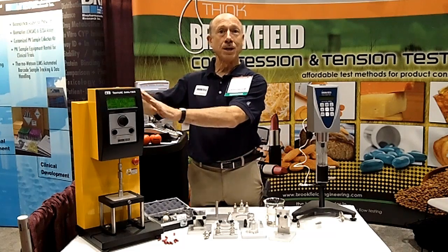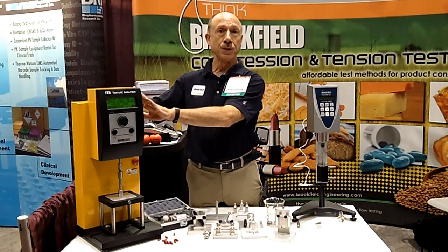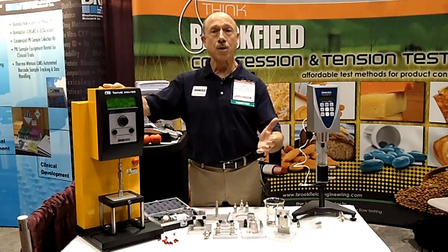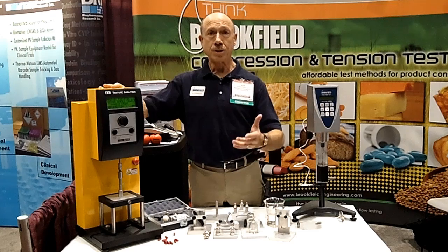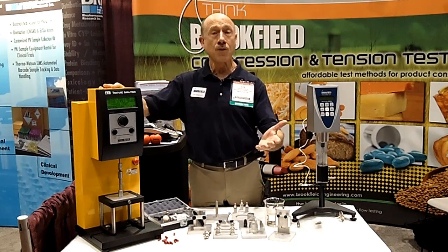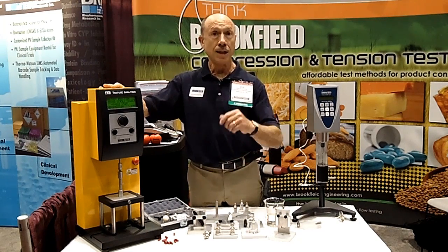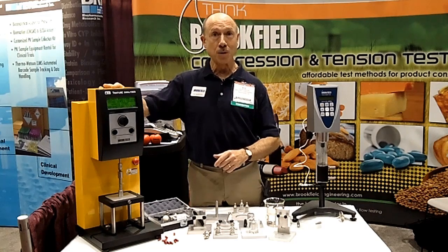I'd like to give you a few words about the Brookfield Texture Analyzer, also known as the CT3 Tester. This type of instrument is used by the pharmaceutical industry to test tablets and capsules to make sure that they have good integrity, to determine their fracture strength, and to see if they will hold up under various conditions of handling, consumption, and chewing by the consumer.